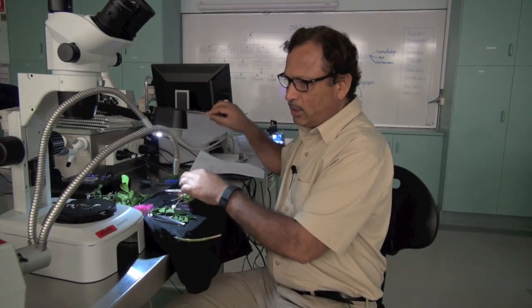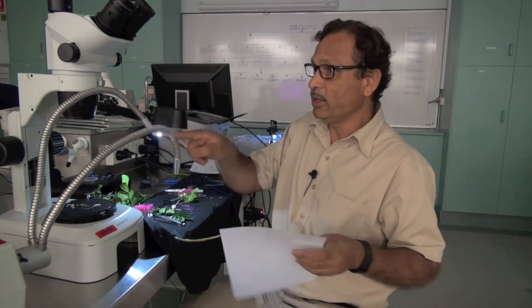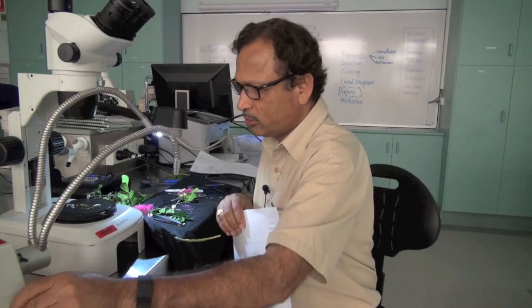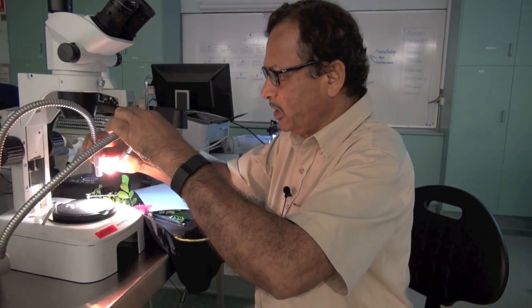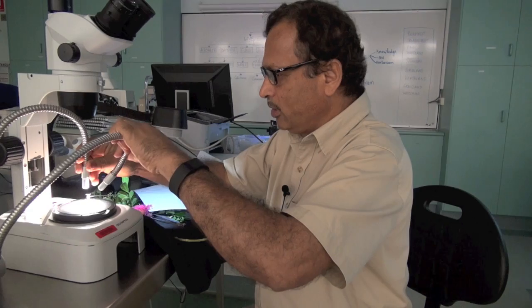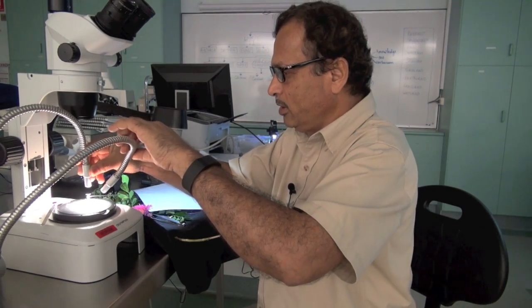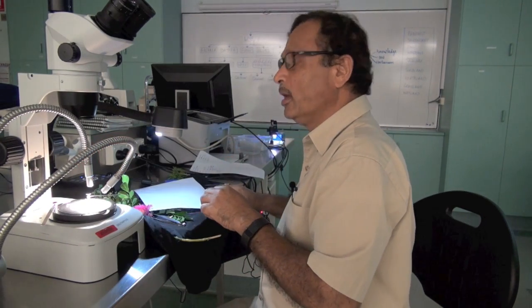So in this case, we don't know how many are there in the other species. I will again show you how to take the cross section and look up in a bigger picture, taking a bigger picture from the microscope.